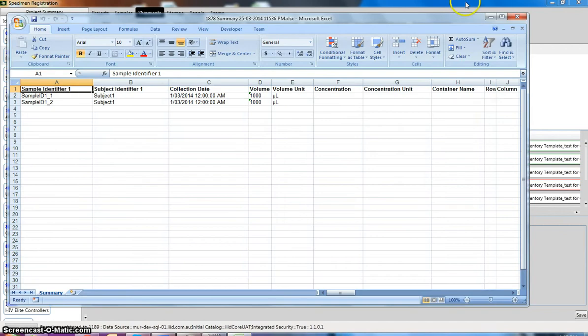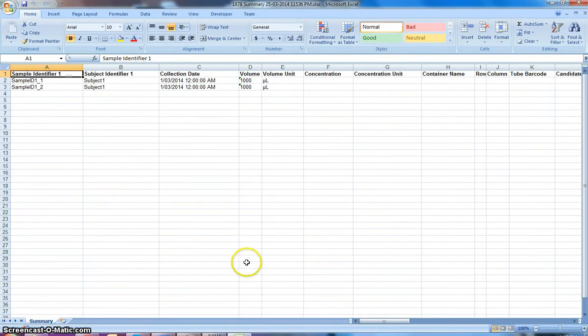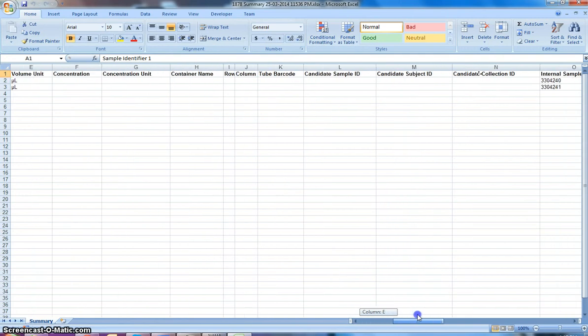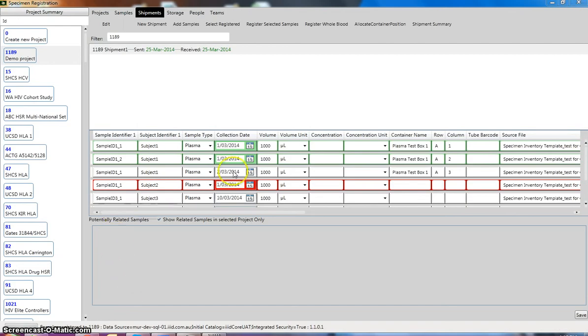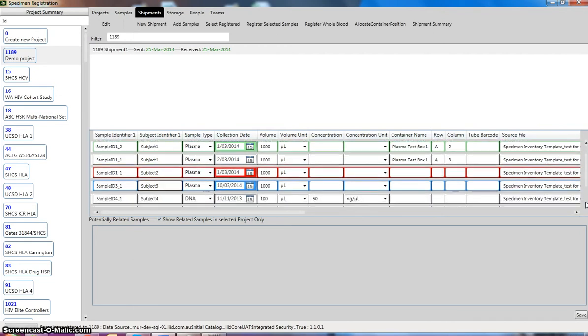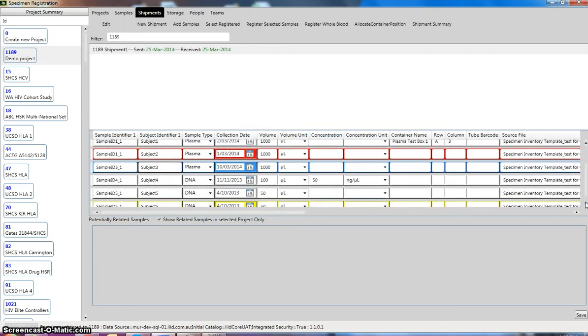An Excel sheet will pop up, and this is what it looks like. It has given it an internal collection ID, and this is what we look at. So this can be closed. The other samples that are not in red can also be registered, so I'll do those ones as well.